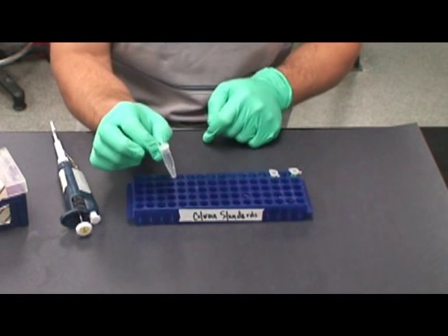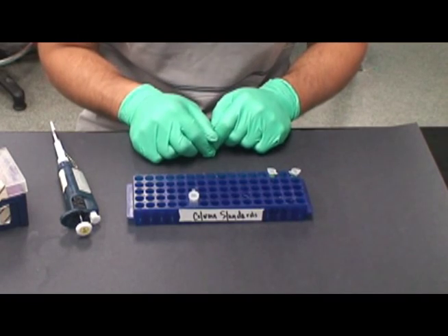In a similar manner, 12 microliters of sterile water are then pipetted into each tube.